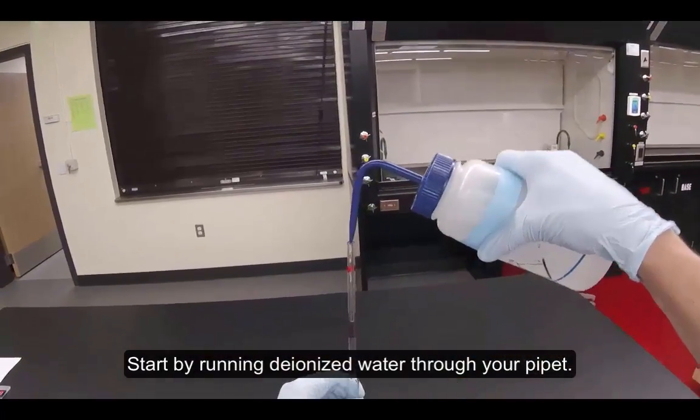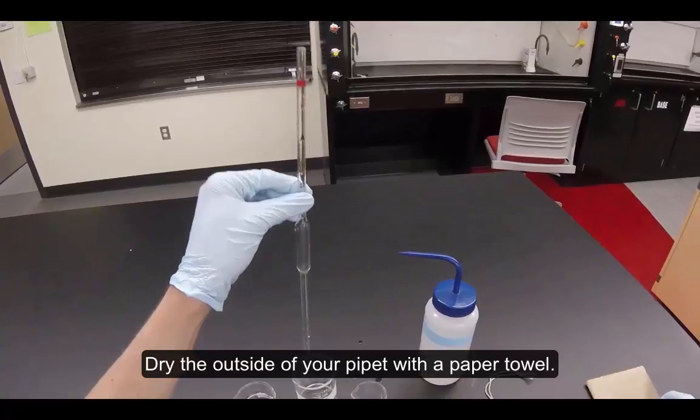Start by running deionized water through your pipette. Dry the outside of your pipette with a paper towel.